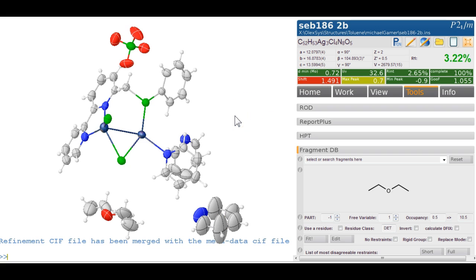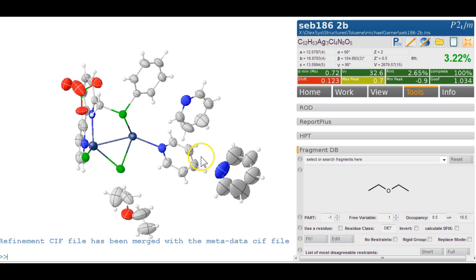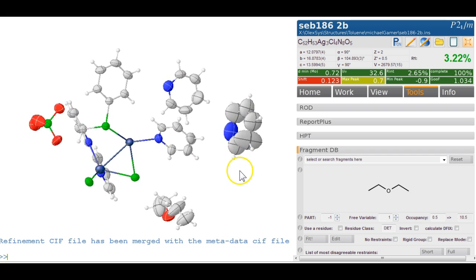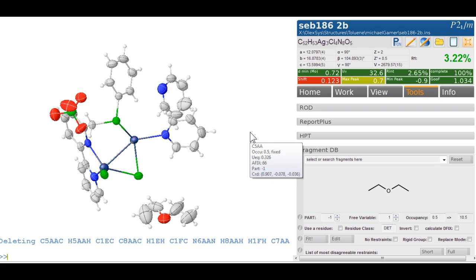It's obviously those ones here. So let's just give it a good spin. Refine 20 cycles, and just follow it up and see what happens. Yeah, it's actually settling. It's not a very pretty pyridine. In fact, one could argue that maybe this pyridine is not really worth modeling altogether. So just for the sake of the argument, I'll show you what you would do if you didn't want to model it. I double click on all of this and delete it.